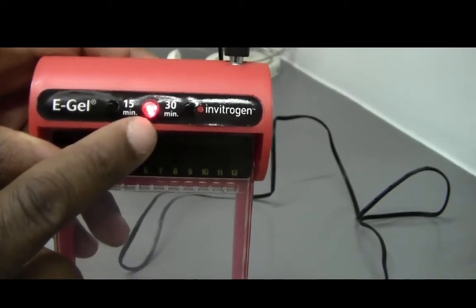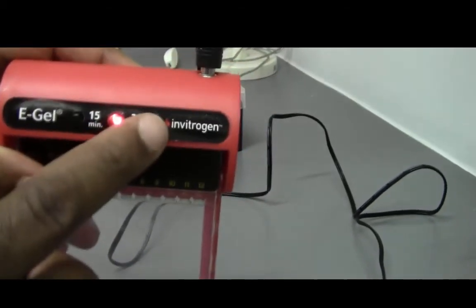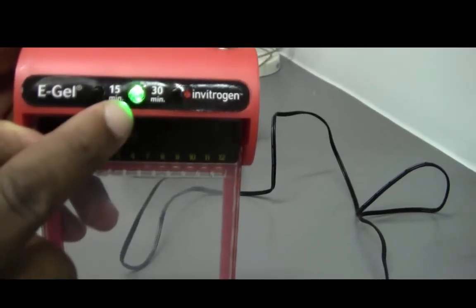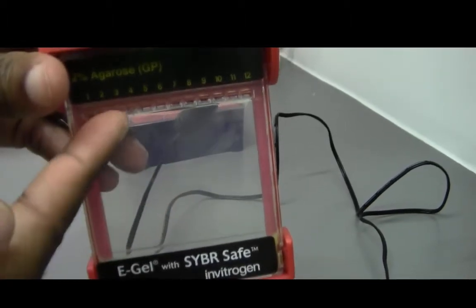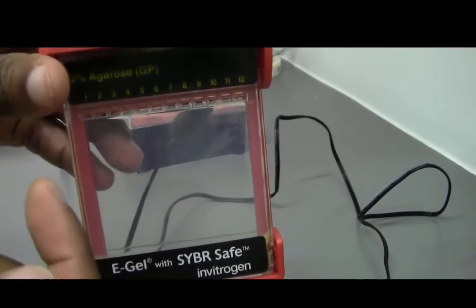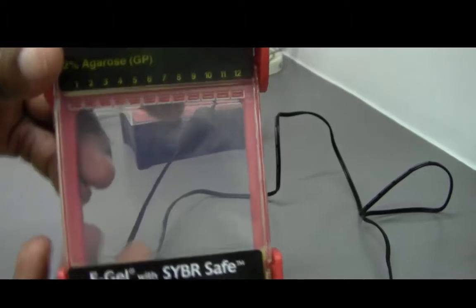If you're using DNA samples you just press the 30 minute button. It'll turn green and then 30 minutes later it'll start to beep. You'll see the DNA samples going down and then it'll beep very loudly when it's done.